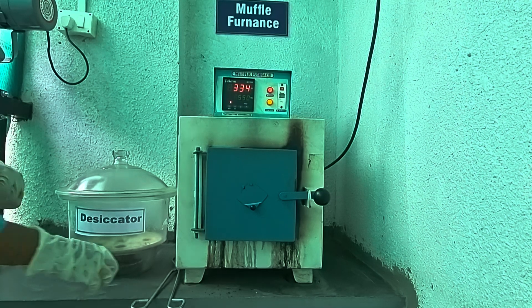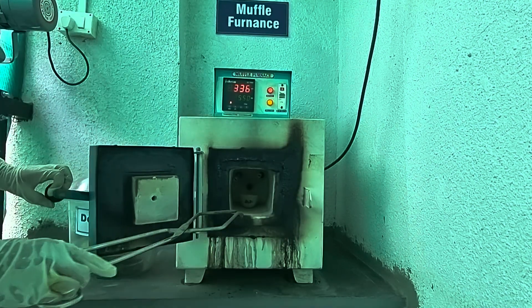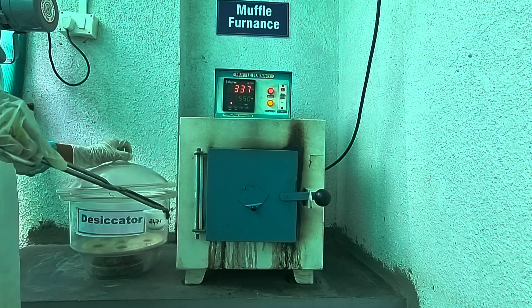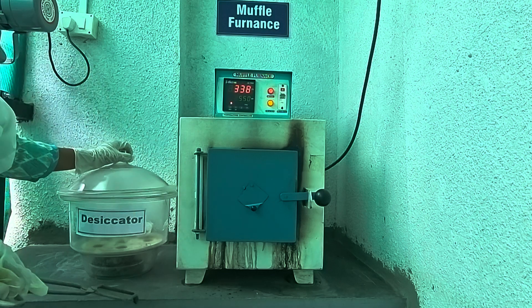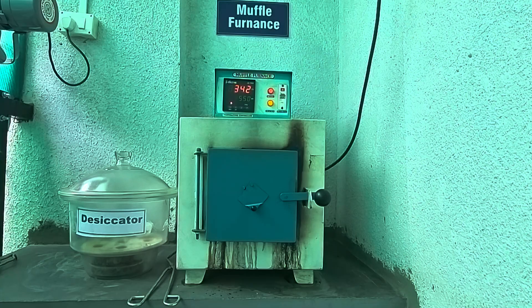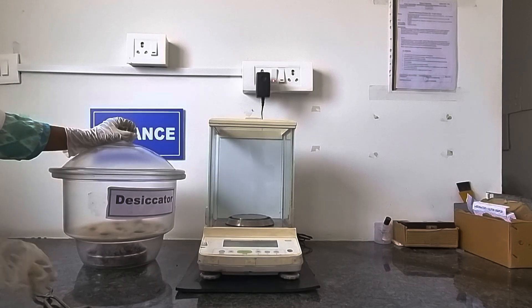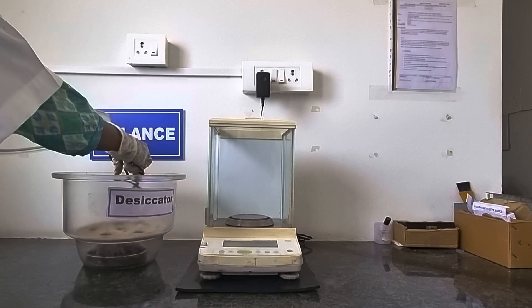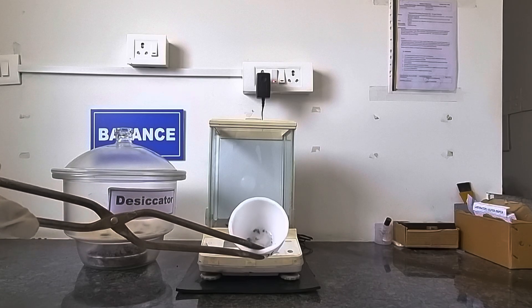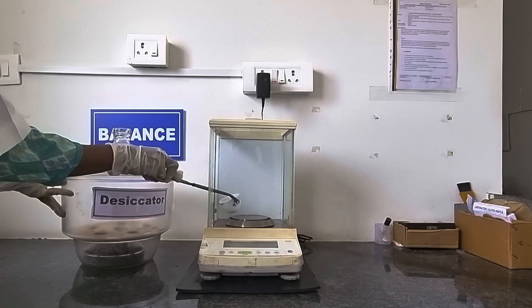After 3 hours of ignition, we will now remove the silica crucible from the furnace. You have to remove it very carefully because the temperature is higher in the furnace. This is the actual procedure of ashing. Now we will take the final weight. After complete ignition, this is actually the ash which we got in the crucible. This is the actual ash content which we get after ignition from the furnace. We will take its final weight for the resultant calculation purpose.